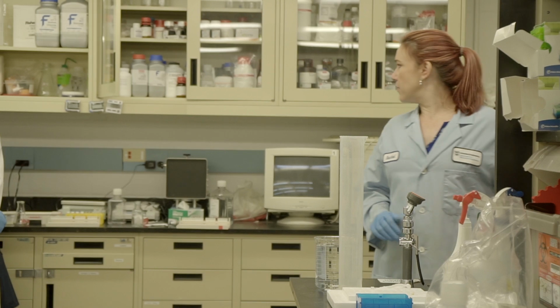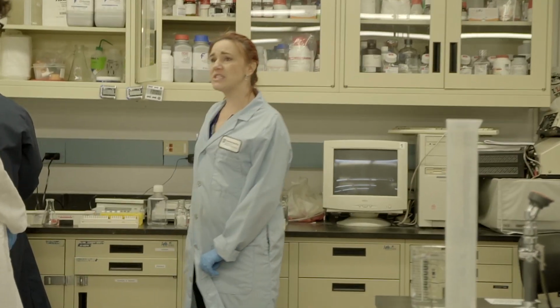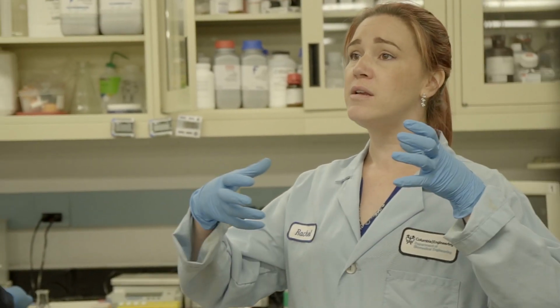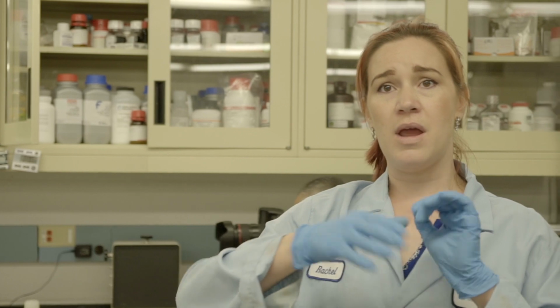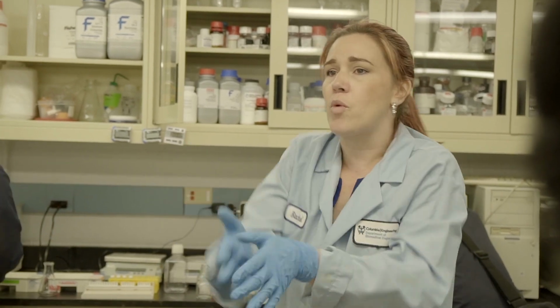So, all right. Mike is over here measuring agarose. Agarose is kind of like a sugar. And when we mix this with our TAE buffer, it's going to turn into a gel, as the name implies, and harden. And that's going to form a whole bunch of little pores within our gels that our DNA has to get through. And because we talked about this in the lecture, the bigger pieces of DNA are going to take longer to worm their way through those holes.